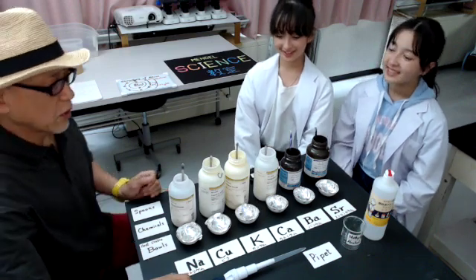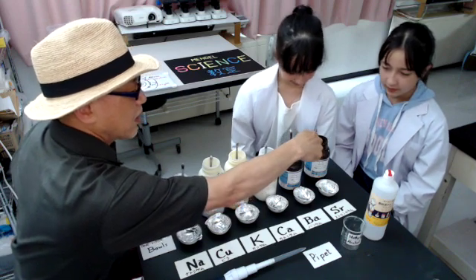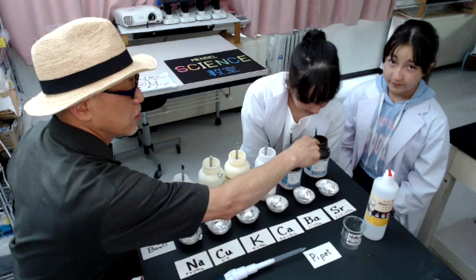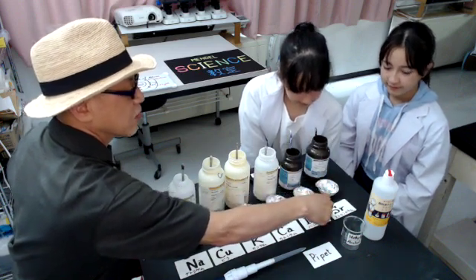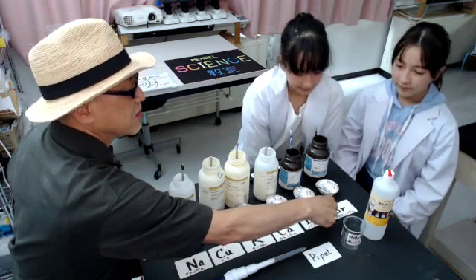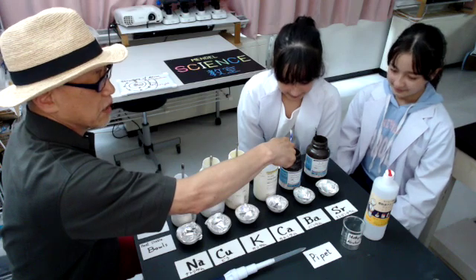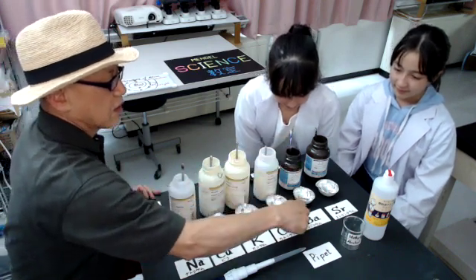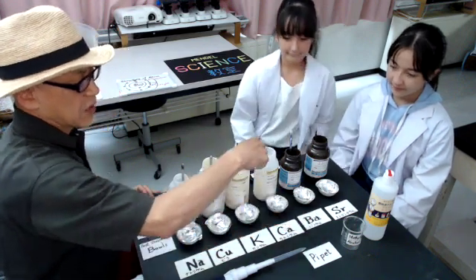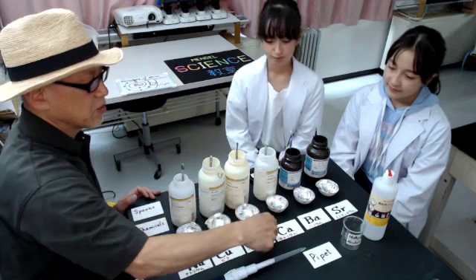From here, this chemical is strontium, and the element symbol of strontium is Sr. So I have wrote the character of Sr like this. This one is barium, element symbol is Ba. This chemical is calcium, symbol is Ca.